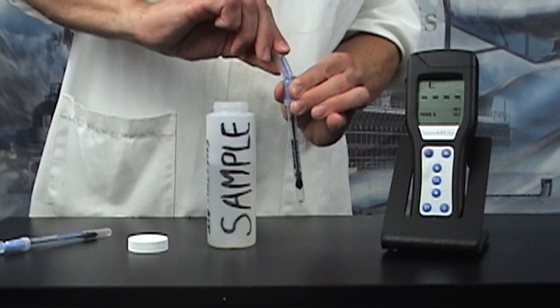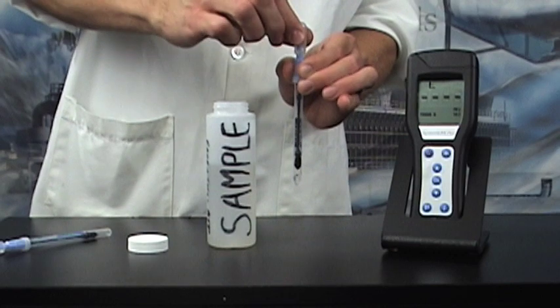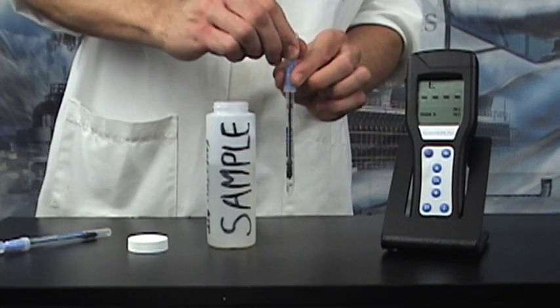Crack the top plastic piece. Squeeze the bulb and shake gently for 5 to 10 seconds.